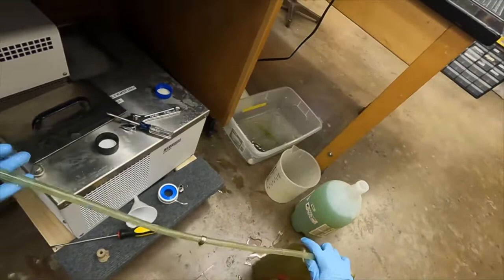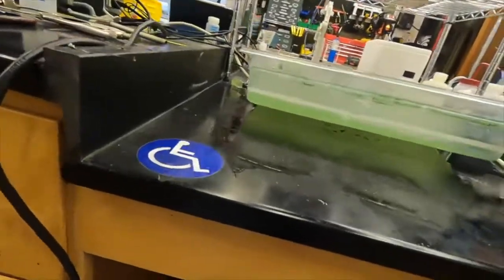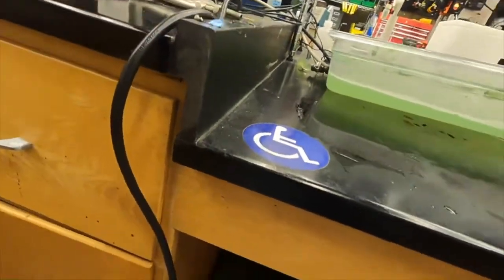Towards the end, this is sometimes easier - you can kind of tilt this bucket up just so all the fluid drains out of that pipe over there.